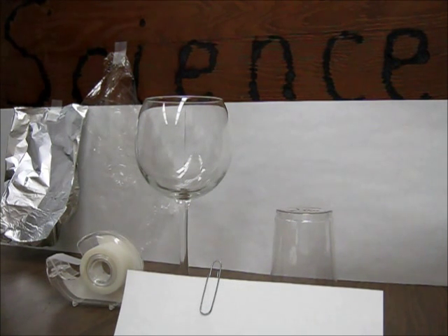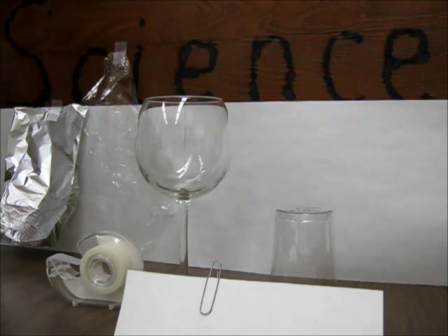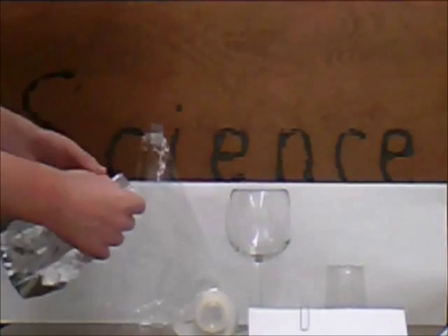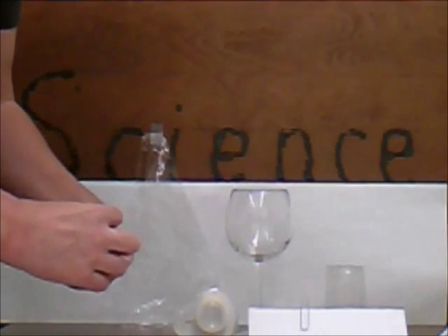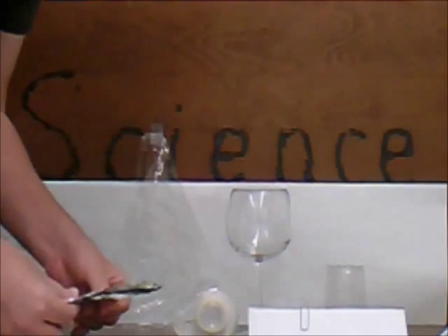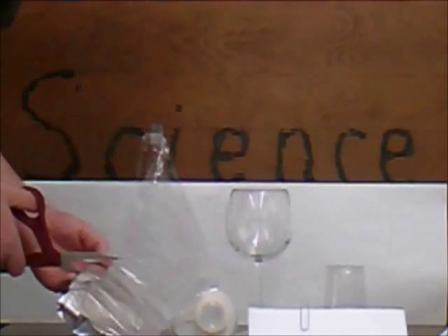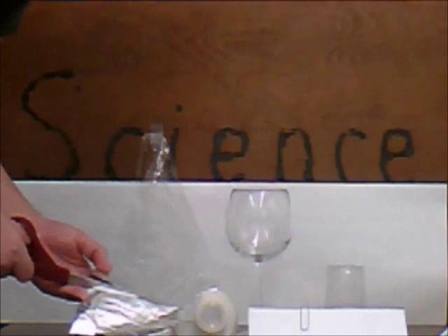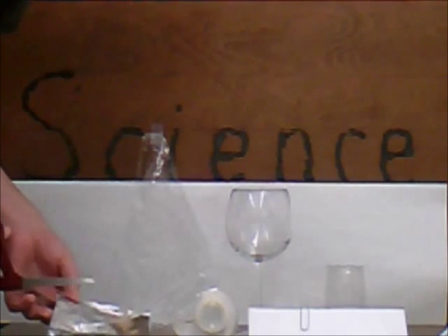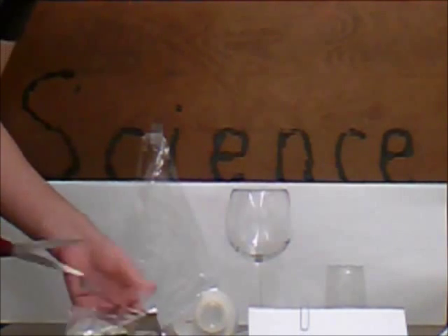Today, I will bend what I need around a piece of wood to show you that it can be done easily on the side of a table. I start by taking my aluminum foil and cutting two pieces of it. The important part here is that the pieces of foil will hang in thin little strips. So the biggest thing for me is to have everything be matched and even. So I cut out a square of my aluminum foil, and I actually measured this before. Not quite a square. But I've folded it in half already so that everything's going to stay evenly matched.